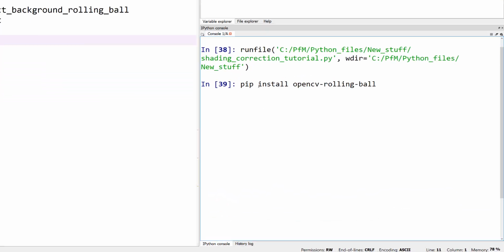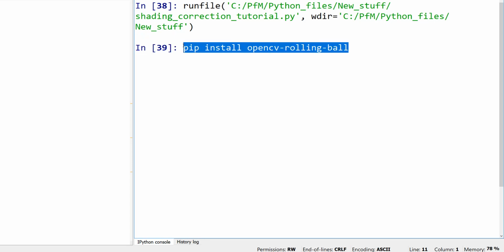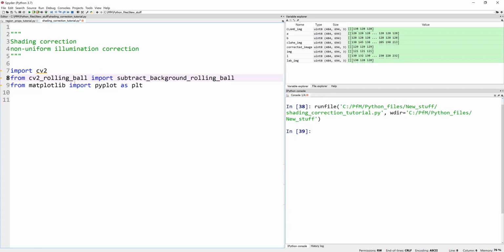To get this, just pip install opencv-rolling-ball. This should install Rolling Ball, and I can also give the link to the PyPI package as part of the description, but this is exactly what we are going to install. Once you do that, you should be able to call subtract background Rolling Ball from this library. That's all you need to do.